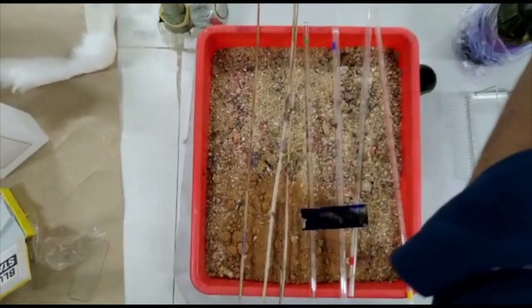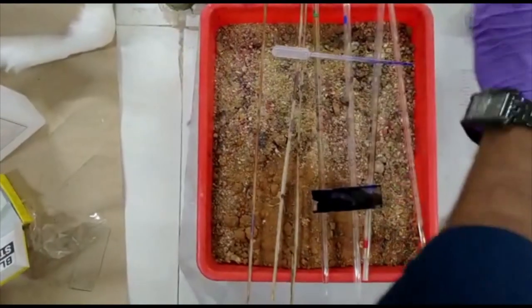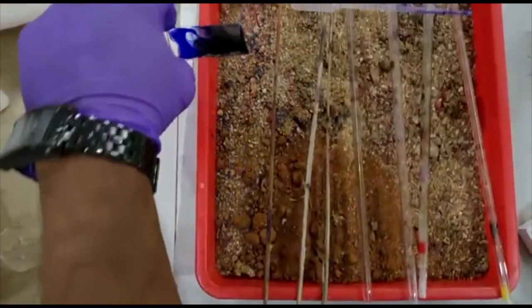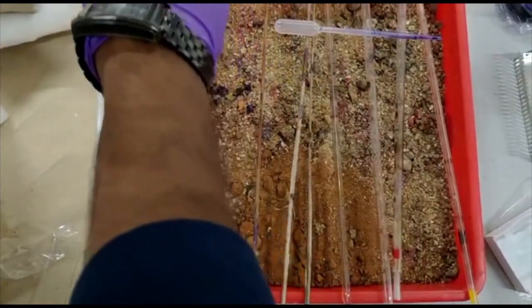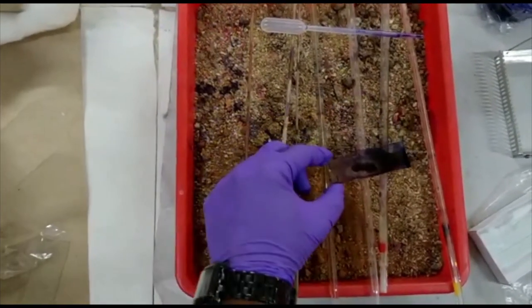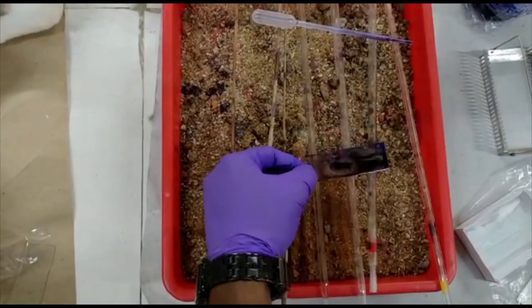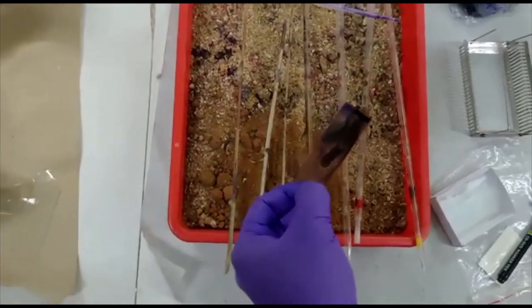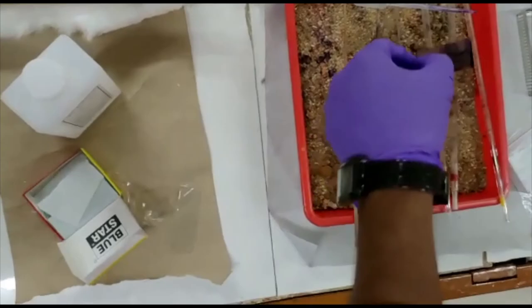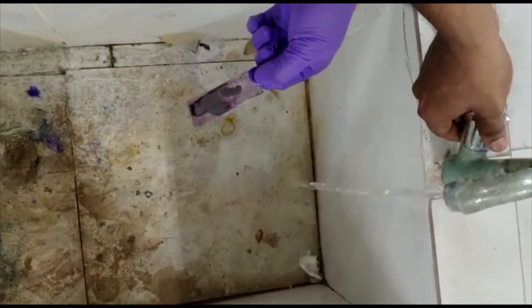The staining should be done on a tray. Add the Giemsa stain on top of the dried smear and keep it for two to three minutes based on the concentration. Then discard the dye and wash the slide under running tap water to wash away the excess stain.